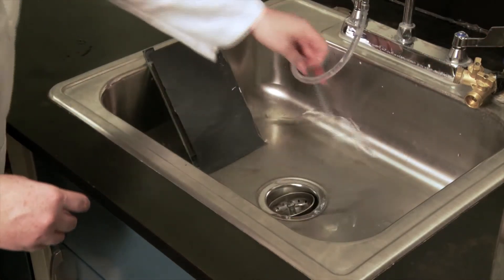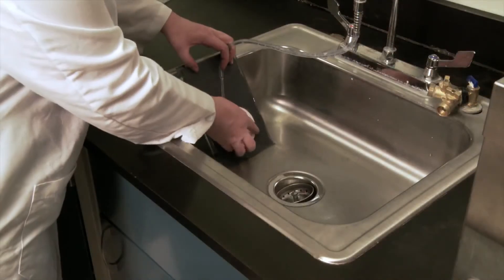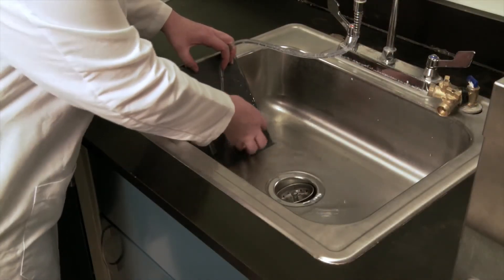Firmly hold the Spectralon panel and in a figure 8 motion evenly apply pressure to the Spectralon and sand its surface.